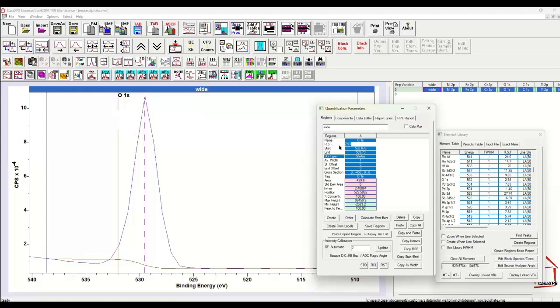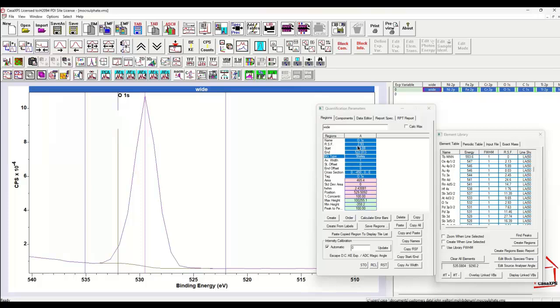However, there's another element to the mass concentration, and that is we must know the mass of oxygen. And because we have created this region using the element library, the mass of oxygen has been brought in and is within the region. Now, the fact that there is an update from the element library can be seen if we look at the tag field. This tag field says O1s, as well as the name field O1s. These were both brought in by the element library.